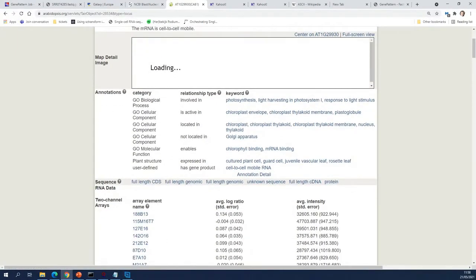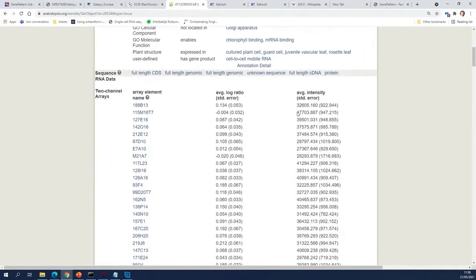and when you take a look at this protein, these are the expression levels of this protein, measured on microarrays. You can see that it's immense. It has a really high expression, so this is why you notice it in your list of duplicated sequences. But it's normal, it's biologically real.